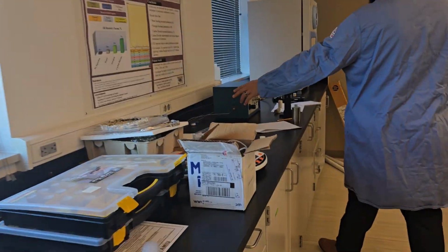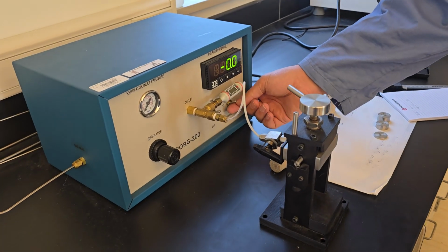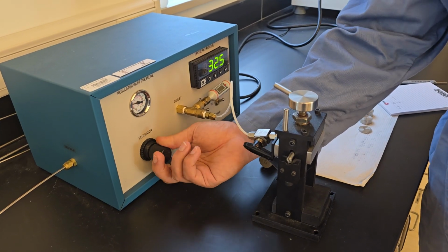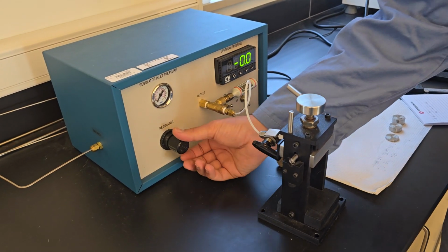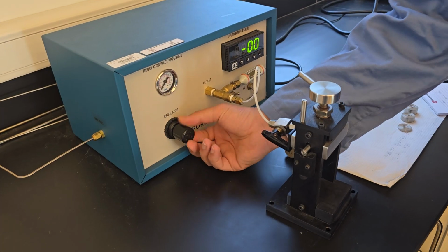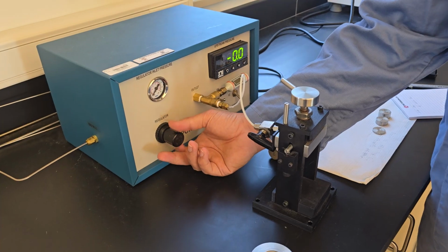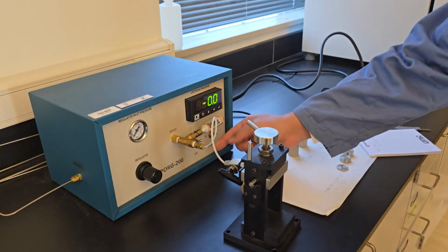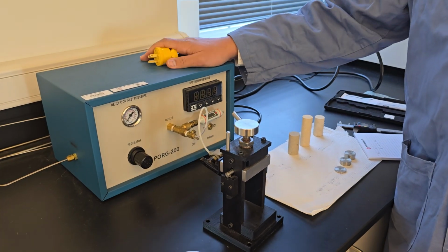And once I do this, I need to deplete all the gas in the pipes, then make it to this equipment. So I'll come back here and I'll put this to on, and I keep this to vent, and I'll close the regulator to release all the gases. So now it's loading. Put this to expand, all the gas comes out from here, and now it's clear. So then I turn the regulator anti-clockwise to close or prevent any gas from getting in. Then I put this to vent, this is to off. My experiment is finished, and I take out the electricity outlet.